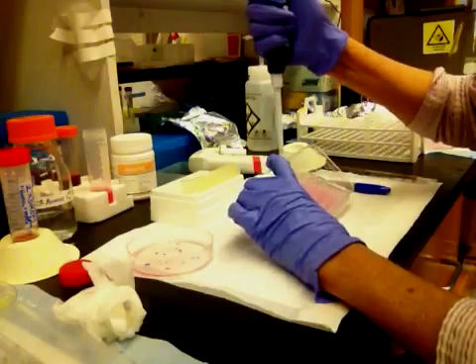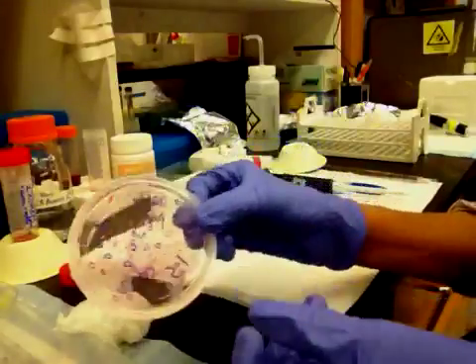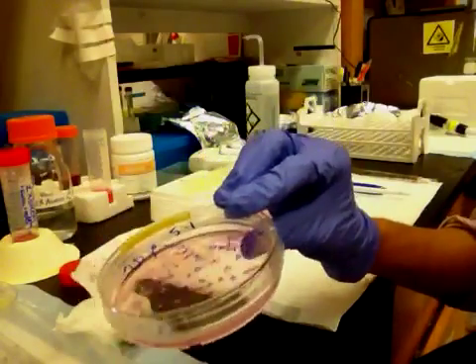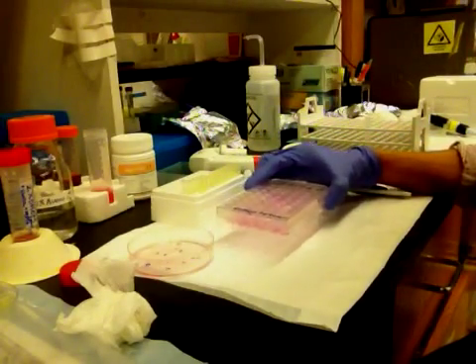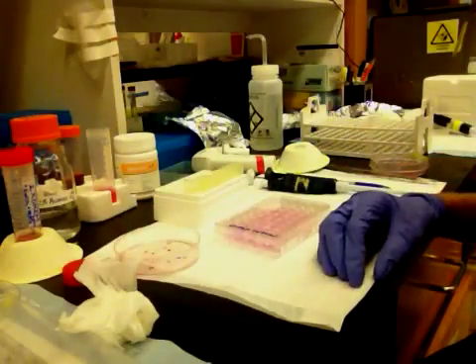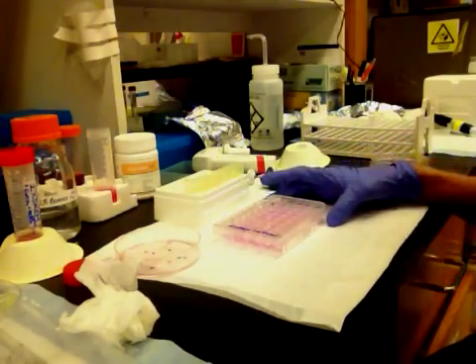That's the way you can pick a plate of clones in 10 to 15 minutes without using cloning rings. This is what the plate looks like after you're finished — it will have a lot of holes corresponding to the clones that have been picked. After all 48 clones are picked, I recommend doing two plates on successive days in case something goes wrong. Then add growth medium about halfway up and let them sit for a week, feeding once a week, at which point we'll do another video on how to screen a 48-well plate painlessly.